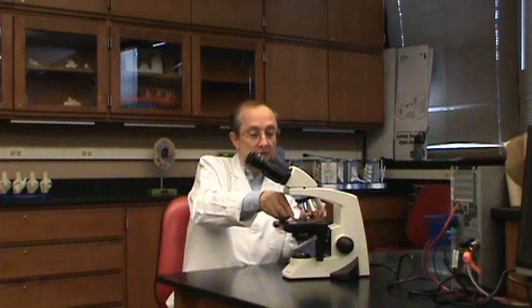Put the slide on top with the spring closed. Now make sure the specimen is centered over the middle of the condenser. This allows you to be certain that as you start focusing you'll actually be focusing on something — if your specimen is off to the side you may be focusing on nothing. Make sure there's some specimen or visible color in the center of the condenser.